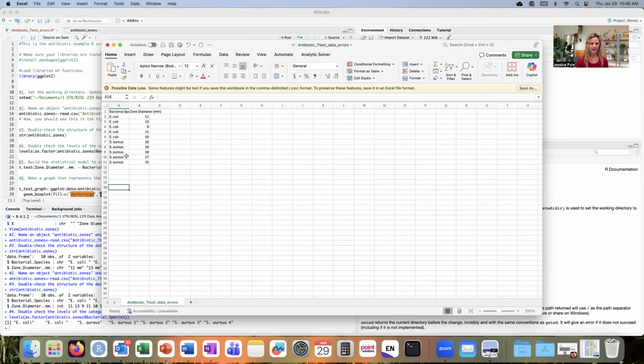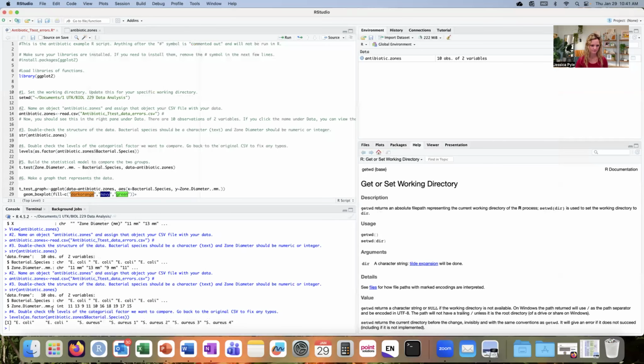Okay, now I know that I need to take a closer look at E. coli. Right now, it looks like all of the E. colis are the same. I don't really see an obvious difference between them. So I need to go back into R and just take a closer look. And I notice when I look at these different levels in R, the first one within the quotes is E dot space COLI, quote. The next one is E dot space COLI, and then I notice there's a space after that. That space is causing R to interpret those 2 entries as being part of different groups.